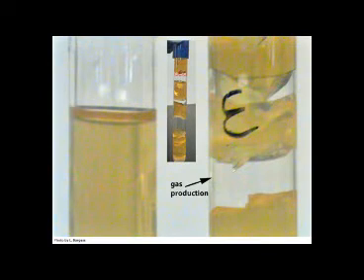Now shown is E. coli. E. coli is a facultative organism. Facultative organisms are capable of both aerobic and anaerobic respiration. E. coli is also capable of fermentation in anaerobic conditions. Facultative organisms are capable of switching their metabolism from aerobic to anaerobic or vice versa, depending on the oxygen that is present in the environment.